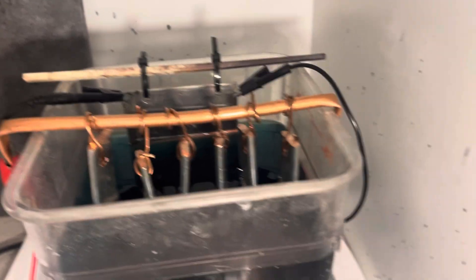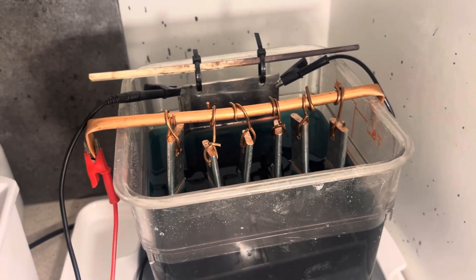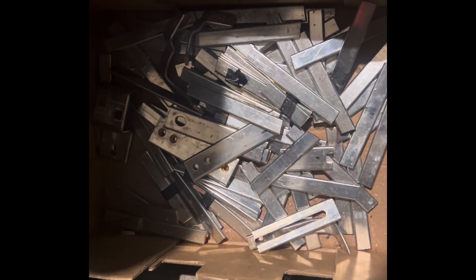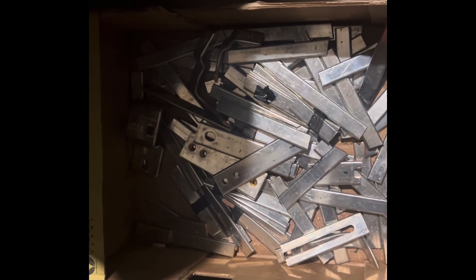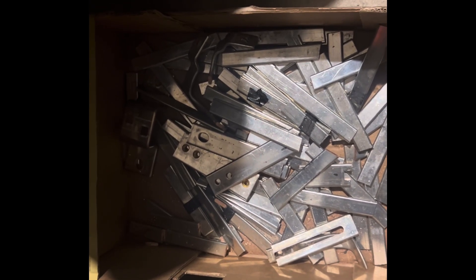We'll drill some more holes and bars tomorrow and see how that works out. We're going to process that silver plate — here it is. I had to cut it up into seven-inch strips and then drill holes in it for the cathode bar. So that's it, let's take a look.